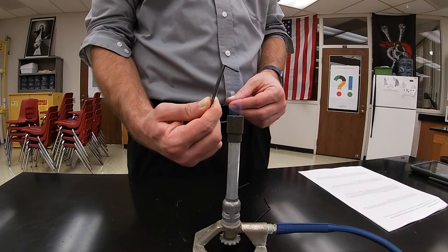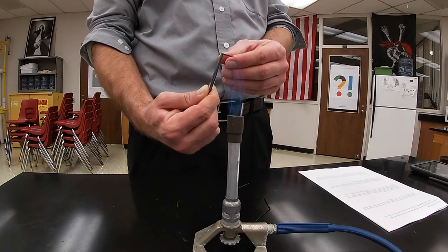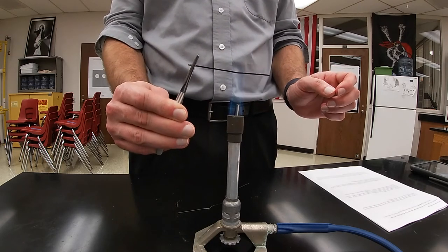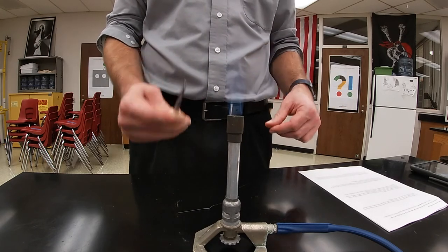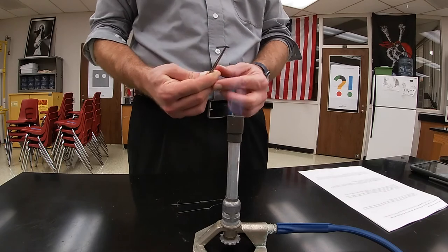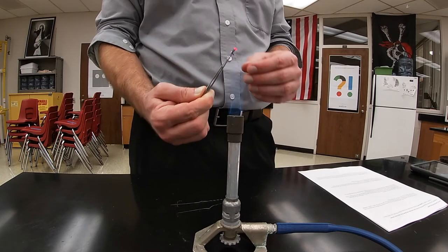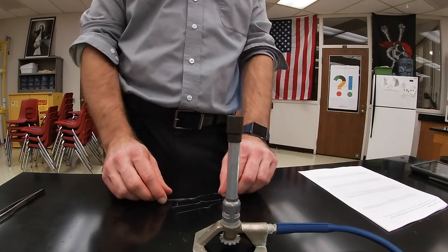The pin has been opened. I want to straighten the other pins, so I'm going to heat them at the hottest part of the flame, get them bright red, weaken the bond, and make them straight. I'll reheat the one that needs more work, then do that for my third pin — burn off the paint, get bright red metal, and open it wide. I now have three straightened pins.